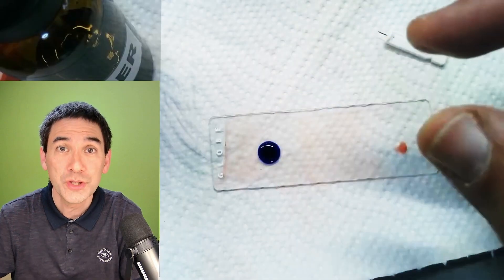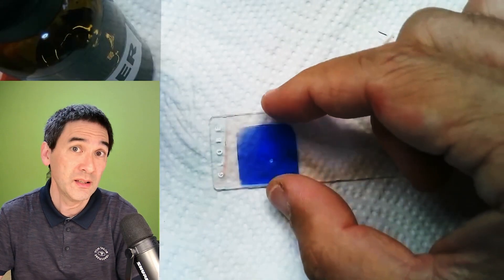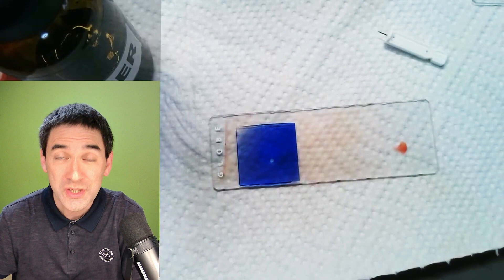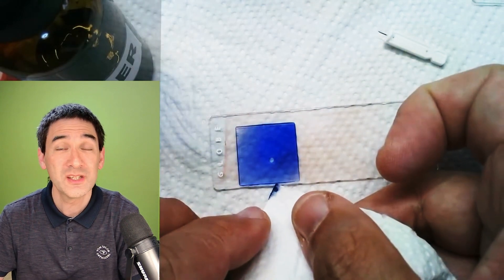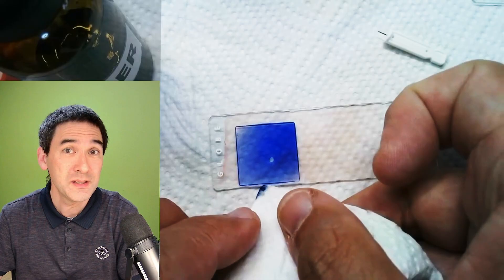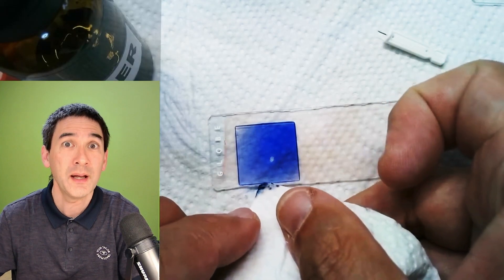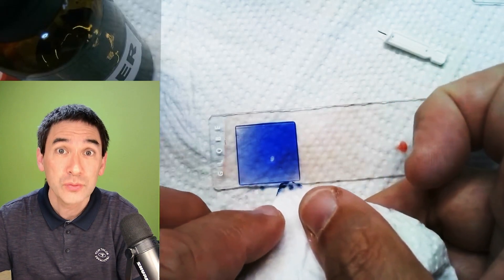This is Loeffler's solution. It's a methylene blue solution with a little bit of alcohol and also potassium hydroxide. I used a little bit too much of this staining solution so it's not pure methylene blue but it's just in the right concentration. You can buy these stains commercially readily made.